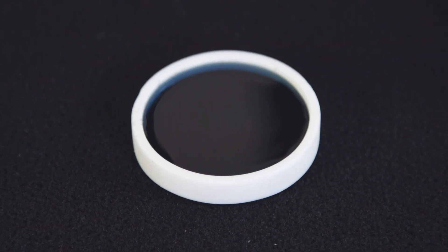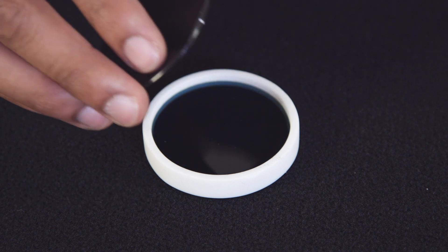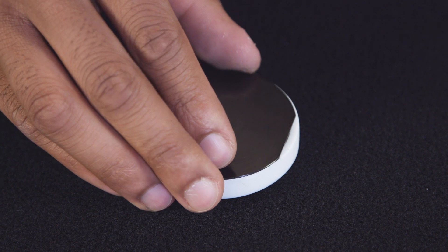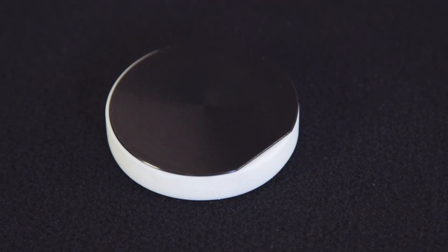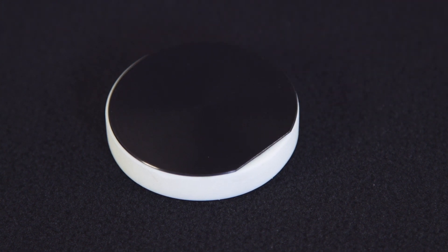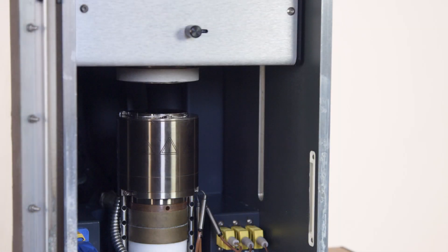This is to create good contact between the liquid cell plates and the liquid, as well as the liquid cell plates and the instrument plates. We want to avoid air bubbles or pockets in the cell that can interfere with our test results. With the cell full, we can now place the top plate on the cell. You will notice that the top plate has a straight edge that allows for excess liquid to escape if necessary. This reaffirms our desire for good contact between the plates and minimized air pockets.